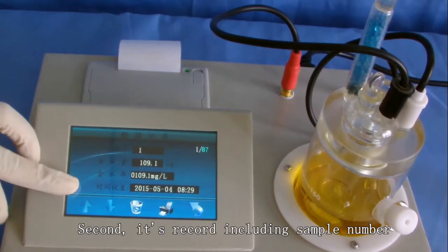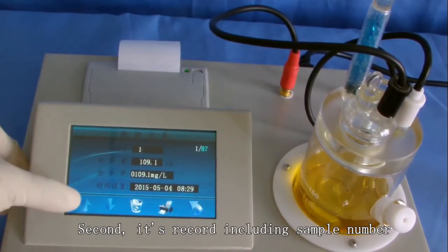Second, it's a record including sample number, moisture content, and time setting.